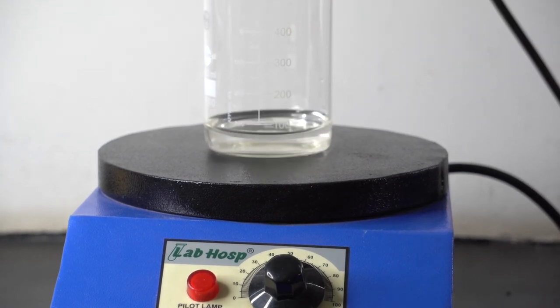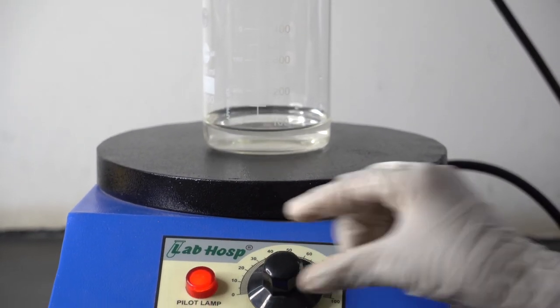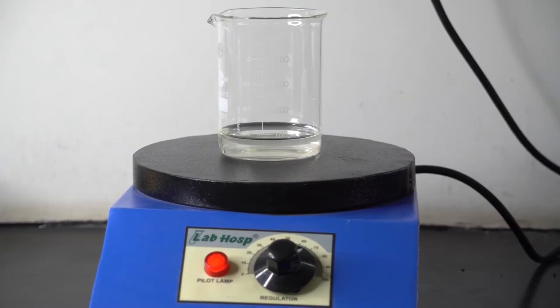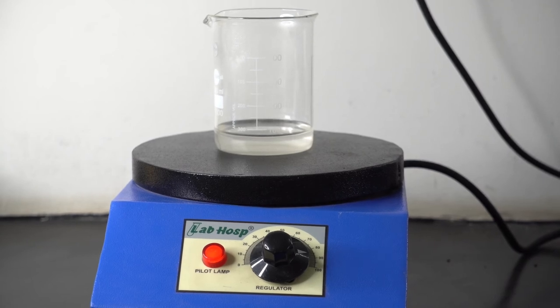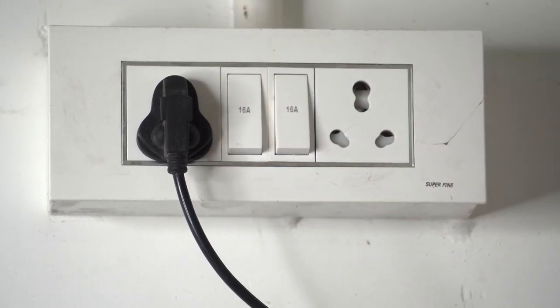Here we have taken tap water as a sample. After completion of the work, switch off the main power supply.